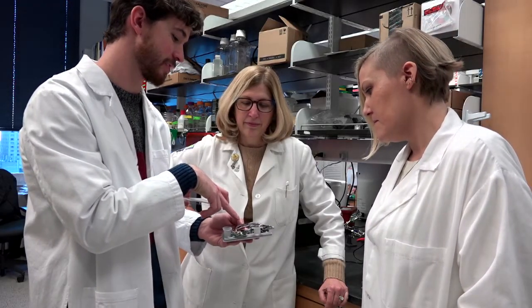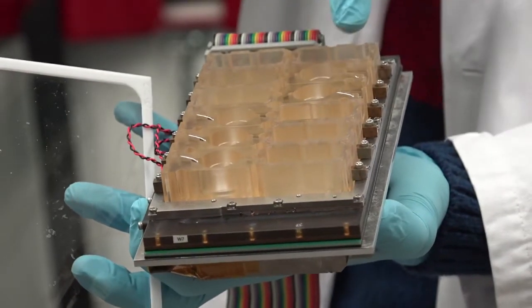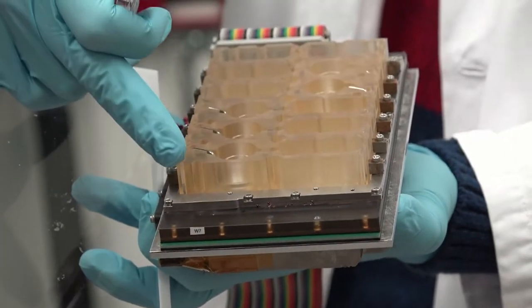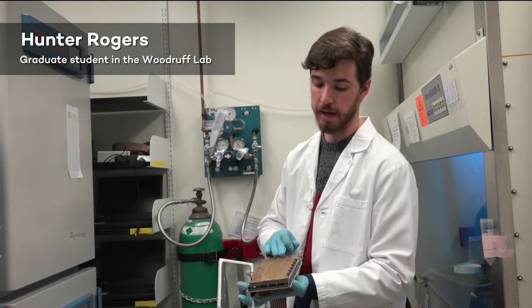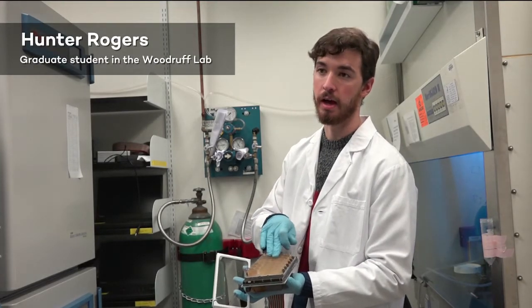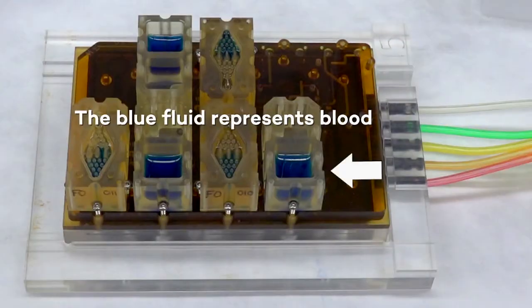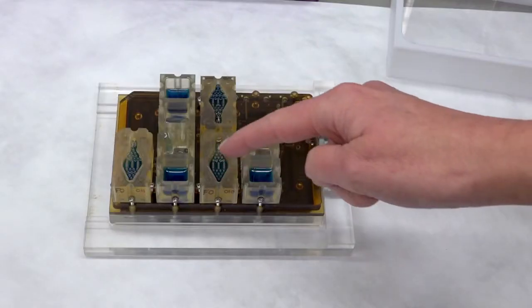The system that we've invented, together with Draper Laboratories, is a series of interconnecting cubes that have individual tubes that connect each of the organs. The fluid can dynamically flow between all of these individual different compartments, just like each of our organs do, as if blood was carrying factors between different organs.